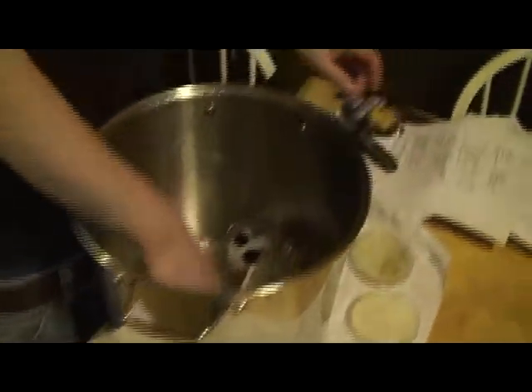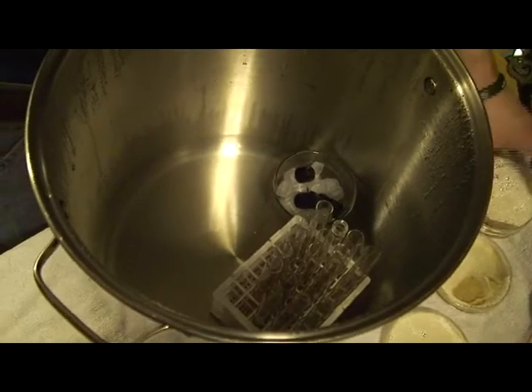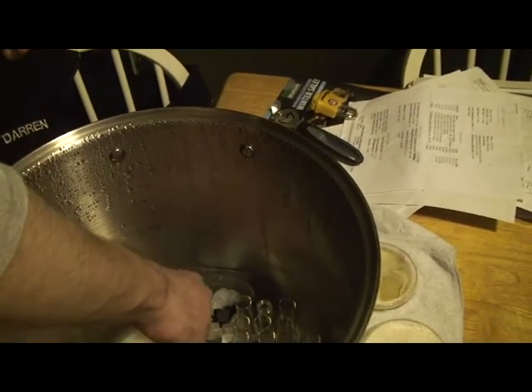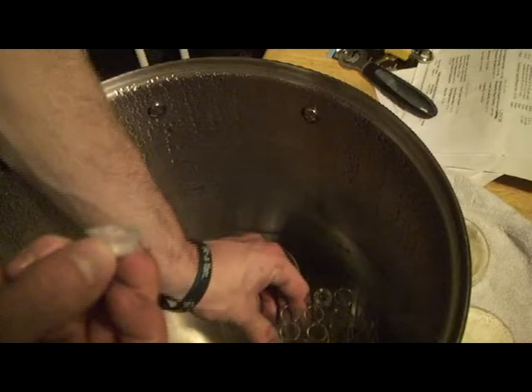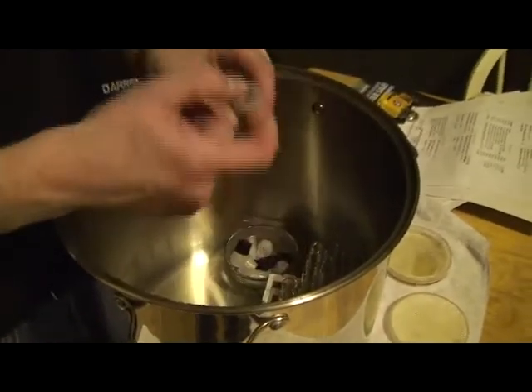Here we are at full boil — everything's coming out of the pot. We just had just enough water in the pot to come up a little bit, not to cover the petri dishes. There's our test tubes, there's our caps. AJ's going to take a cap and a test tube — just touching the sides of the cap, not touching the side or the top of the tube. You really want to keep your breathing to a minimum near the open tubes.